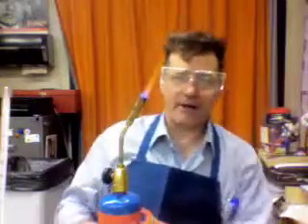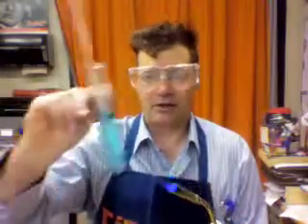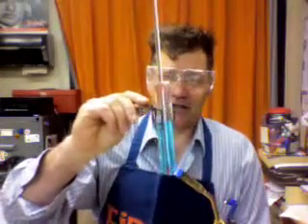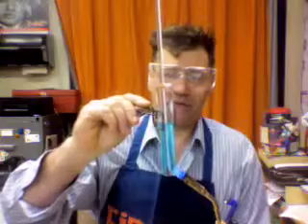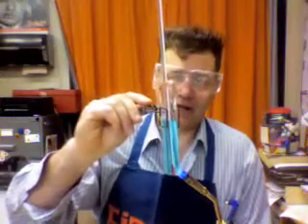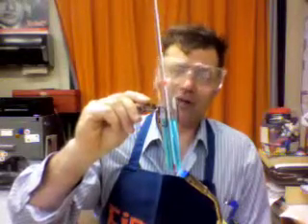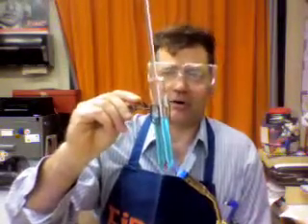Love the smell of propane in the morning. Here we go. Let's heat this thing up. And I can remember doing this lab when I was a kid, so here we go. I'm already starting to get a few little bubbles here. This actually goes pretty fast when you use a torch. It'll be a little slower when you guys use your alcohol burners.